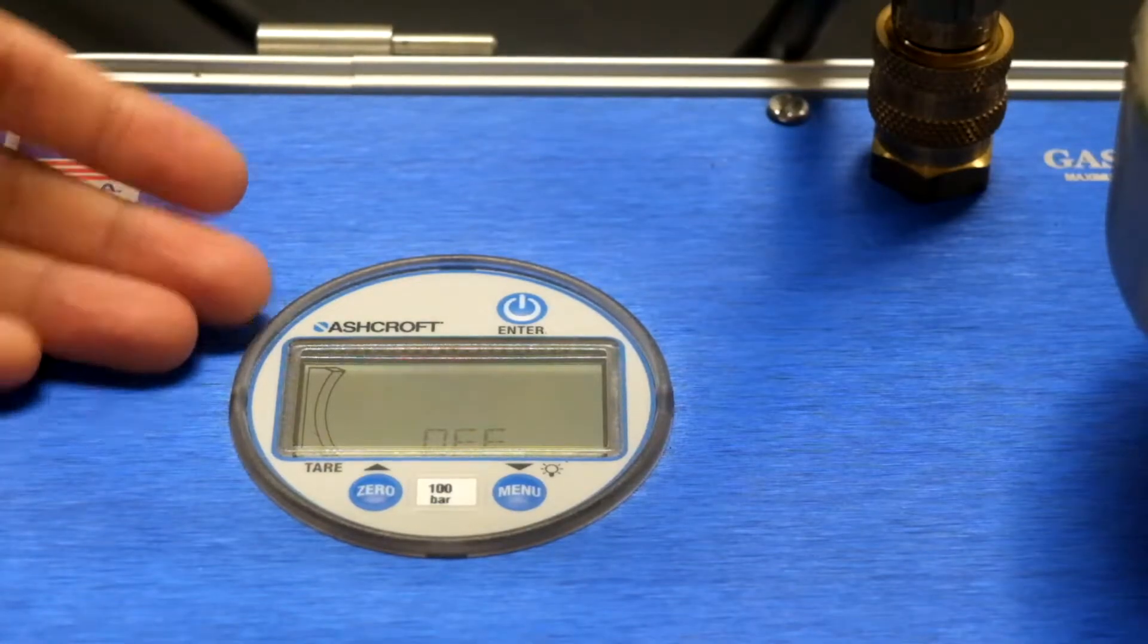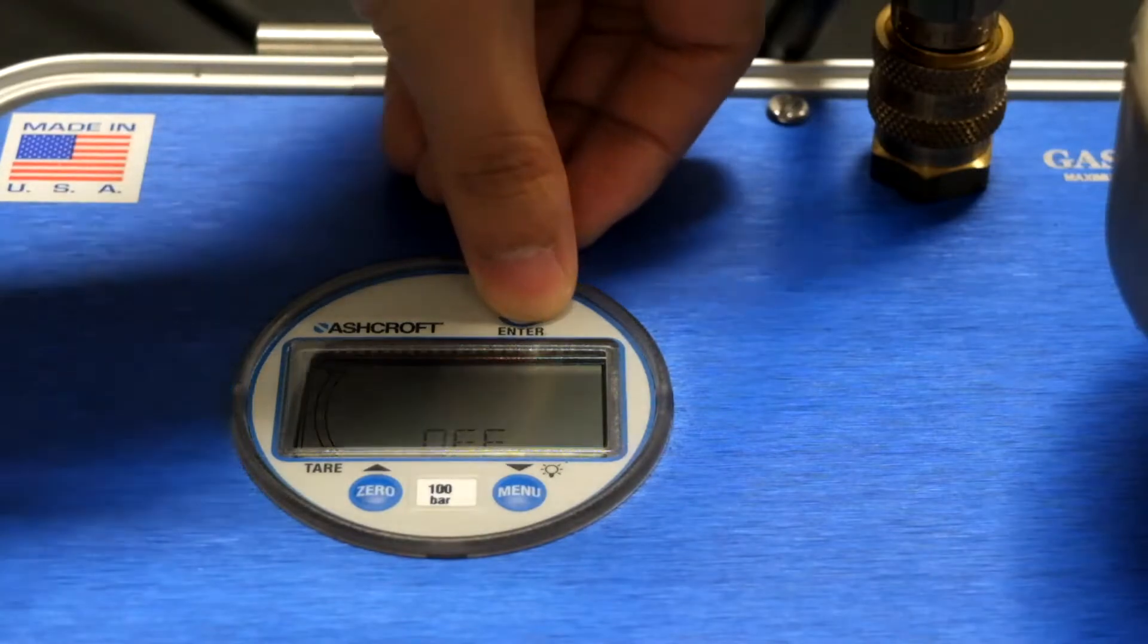Here's the display. To turn it on you press the power button for about two seconds.